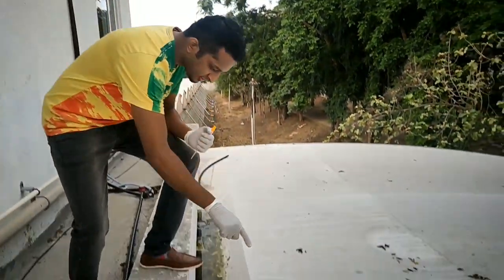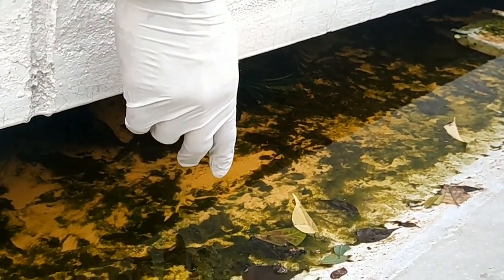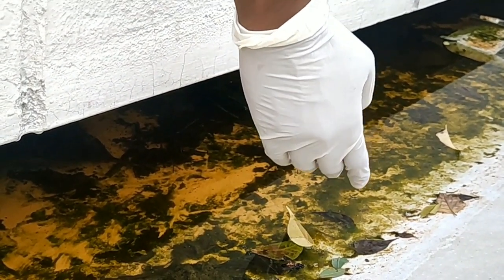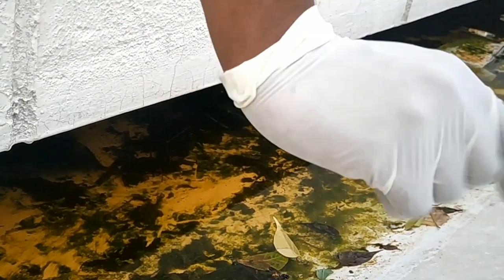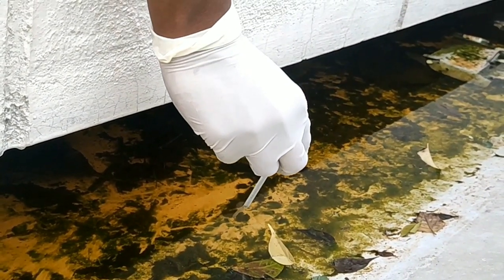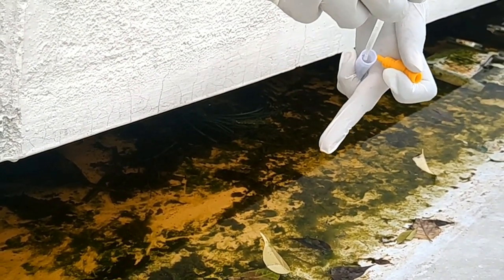We have found our stagnated water area on the terrace. You can see the stagnated water with microbial life in it, along with some insects, dried leaves, and dead matter. This has been stored here for days, so we will now collect the water sample from this.